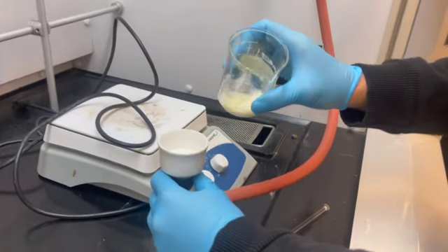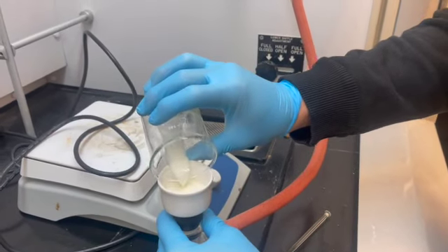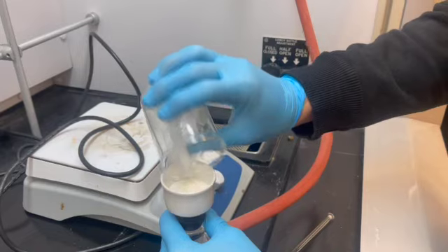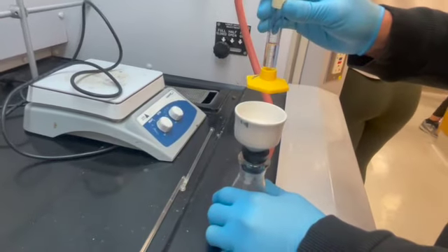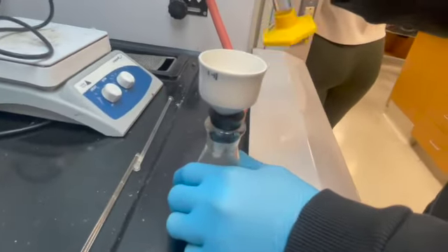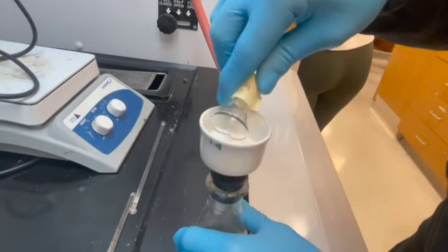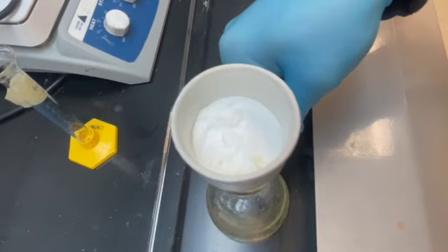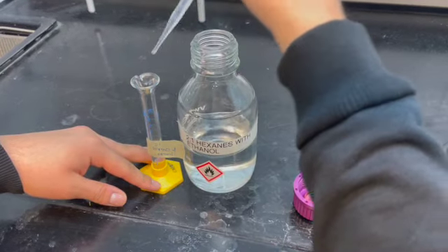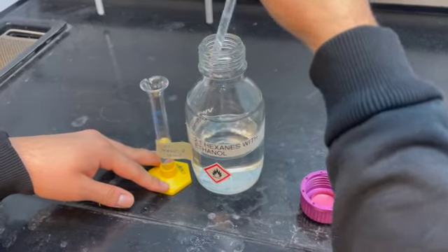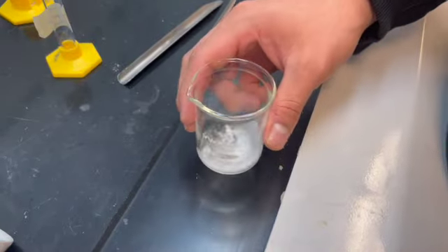We're putting our solution through the vacuum filtration to remove all the liquid from our solid. Now we're going to be pouring 5 milliliters of the 2 to 1 hexane-ethanol into our vacuum filtration. And now we're adding 10 milliliters to our solid.